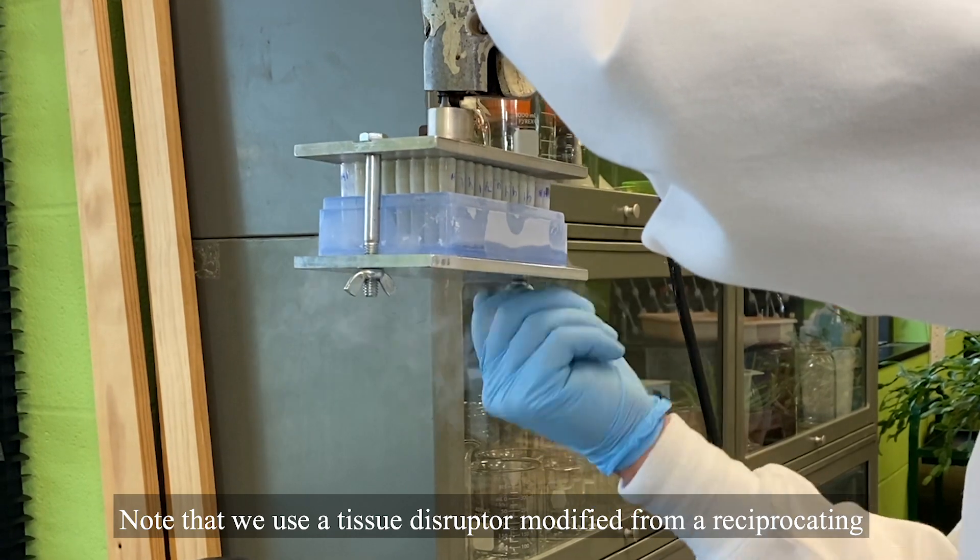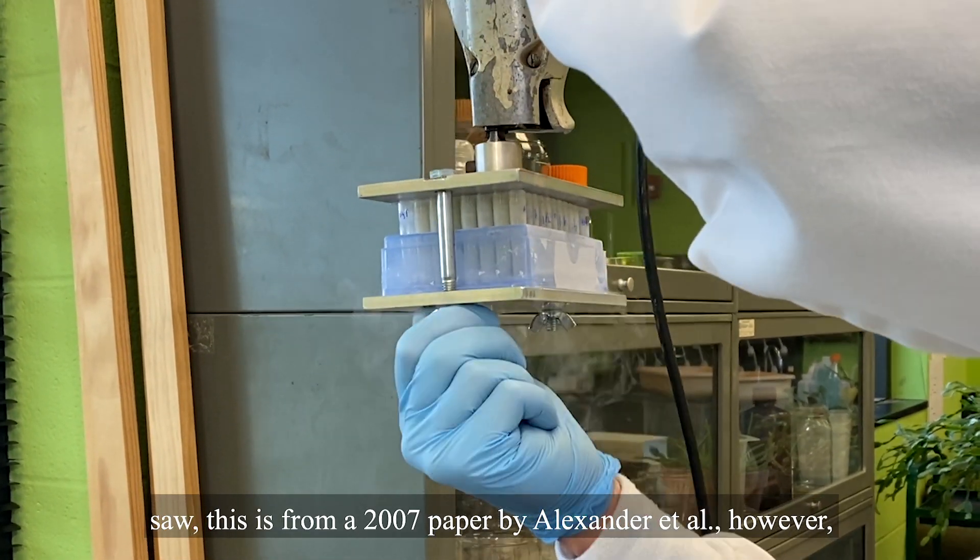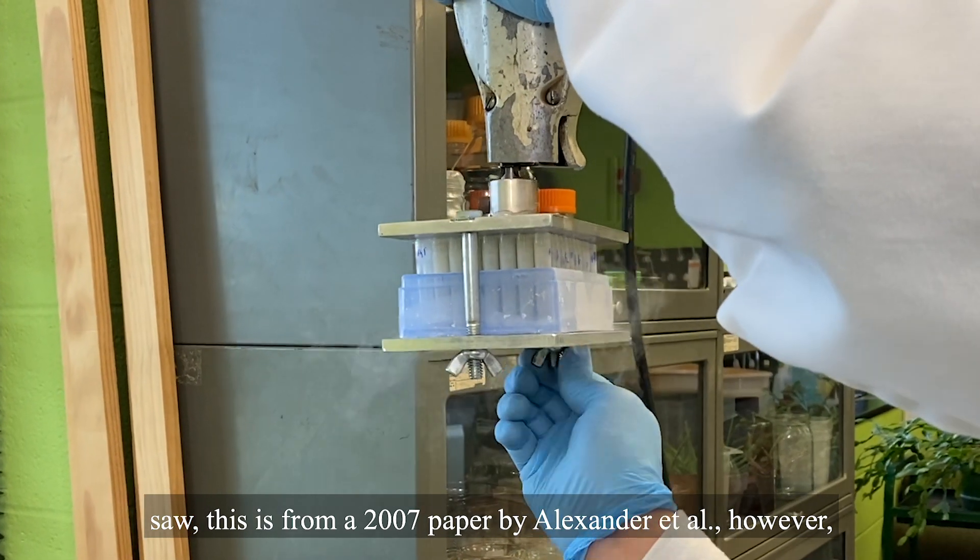Note that we use a tissue disruptor modified from a reciprocating saw. This is from a 2007 paper by Alexander et al. However, commercial shakers are available and will work the same.